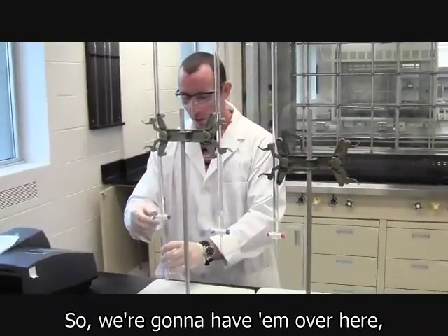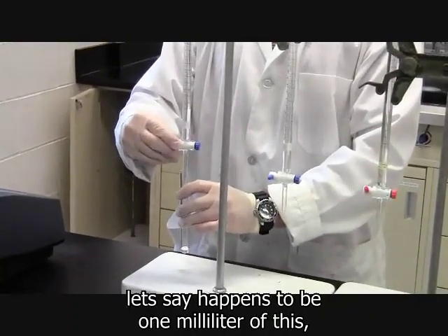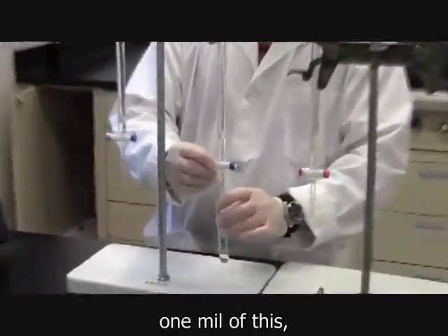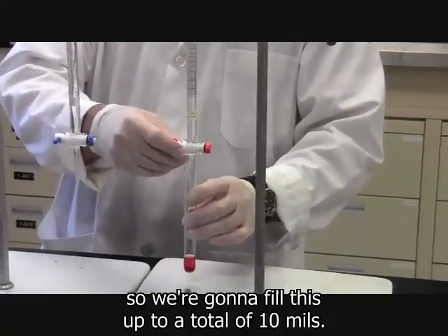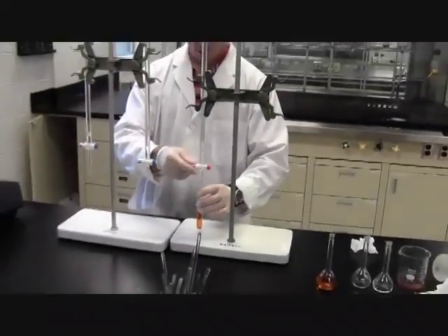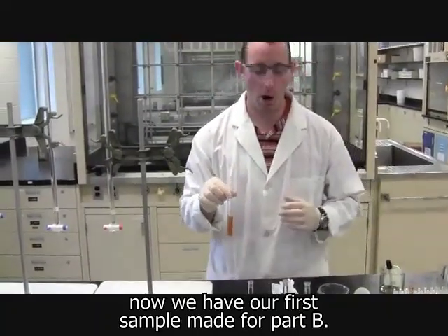So we're going to come over here. What we're going to do is take whatever trial 1 tells us to do. Let's say it happens to be 1 milliliter of this. Then we're going to take 1 mil of this. And we typically go to the end with our water, so we're going to fill this up to a total of 10 mils, so we're probably going to put 8 mils of water in. Shake it up a little bit so it stirs. So now we have our first sample made for part B.